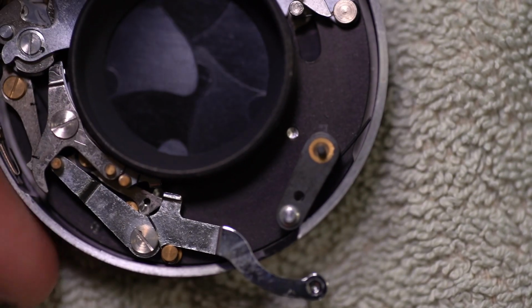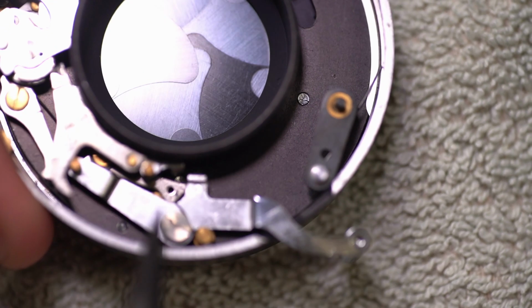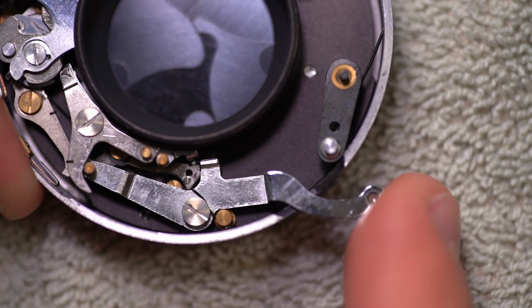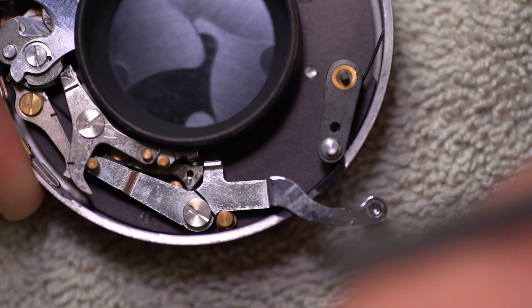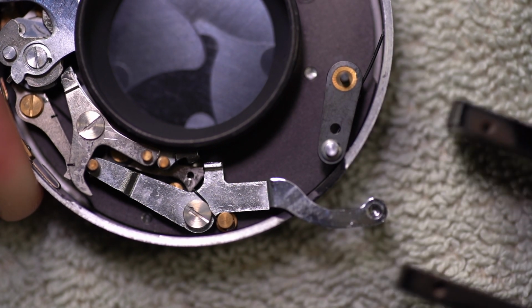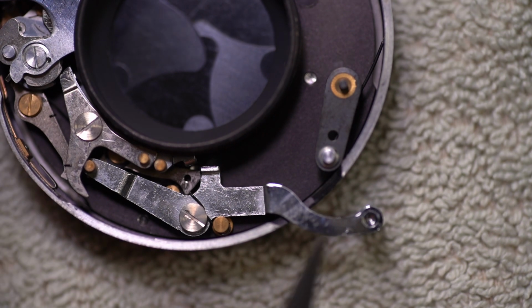Now, this is the problem that I've been having: this thing is intermittently not working. Now, if you see this little thing here, it moves. This big lever is actuated by a cable release, which you're not going to be able to really see, but basically it sticks out like that, hits another piece of metal, it hits this. And again, you use a cable release because you want to introduce the least amount of vibration possible, and a cable release allows you to do that.